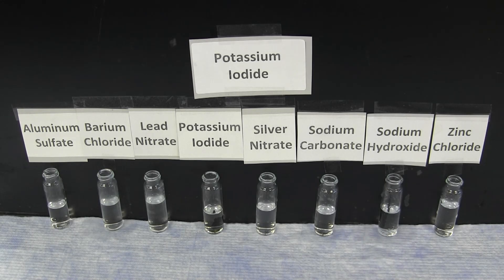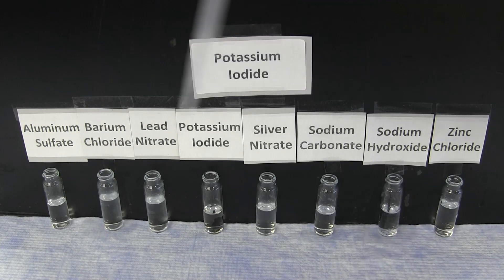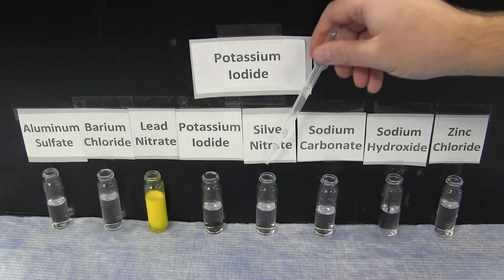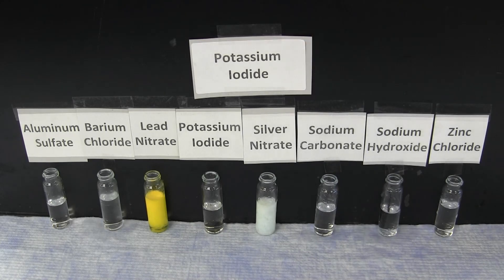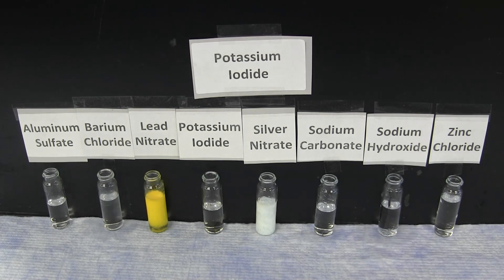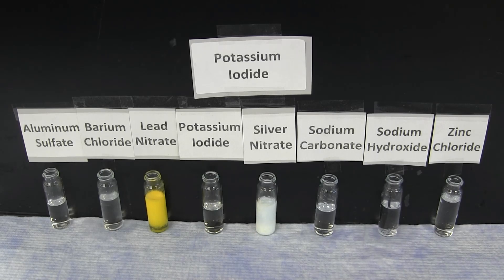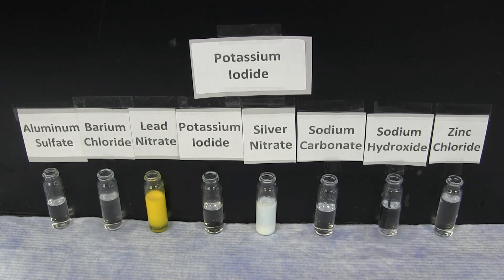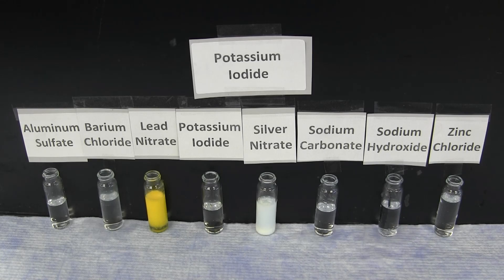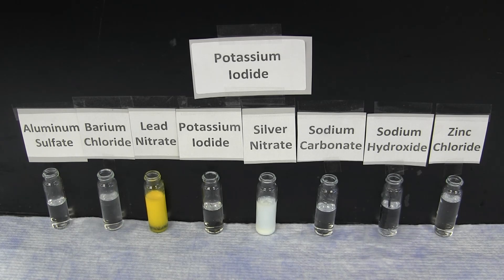The next reaction pattern is that of the potassium iodide solution. The potassium iodide solution forms a brilliant yellow precipitate with lead nitrate, and an off-white, slightly eggshell yellow precipitate with silver nitrate. There is no reaction with aluminum sulfate, barium chloride, potassium iodide, sodium carbonate, sodium hydroxide, or zinc chloride.